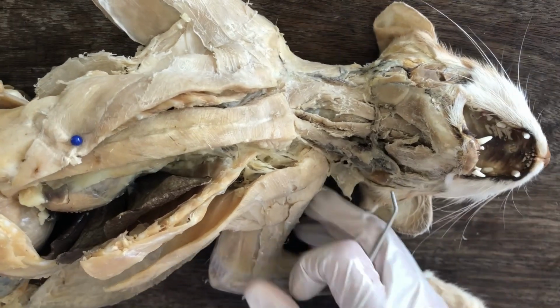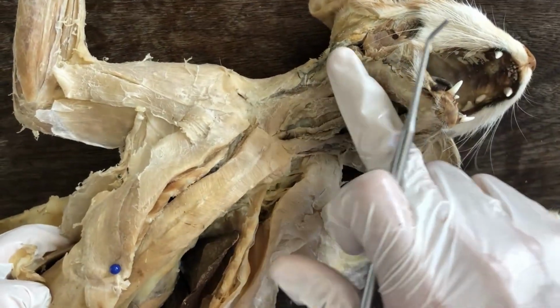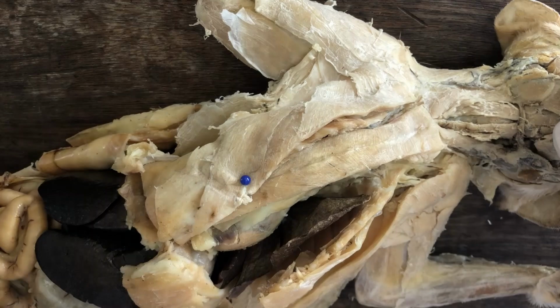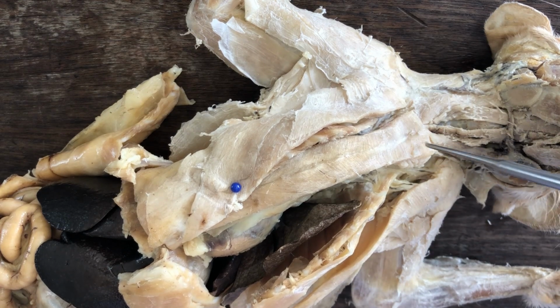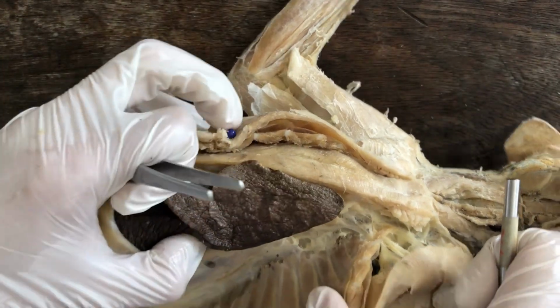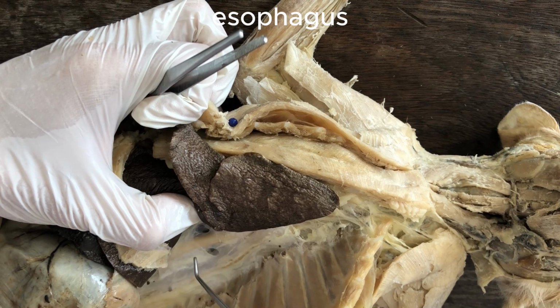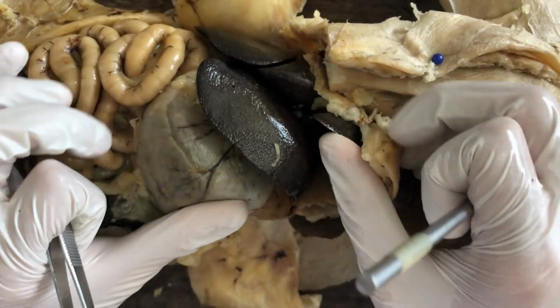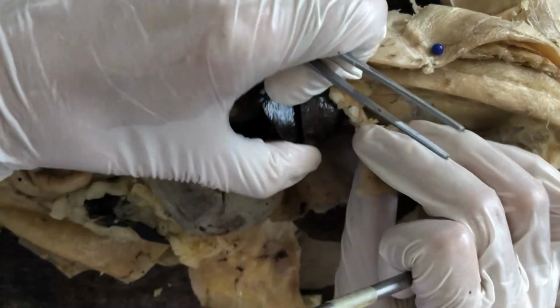So you remember that the digestive tract, of course, originates from the mouth, then from the mouth to the oral cavity, and then to the pharynx, somewhere here. So watch that video first before you proceed here. And then from the pharynx, the digestive tract continues as the esophagus, entering the pleural cavity. Let me show you again. The esophagus there at the dorsal thoracic cavity. The esophagus will penetrate the diaphragm and then emerge here in the peritoneal cavity. Okay. This is an obvious structure. Identify it now if you want, but let's focus first on the main alimentary canal.